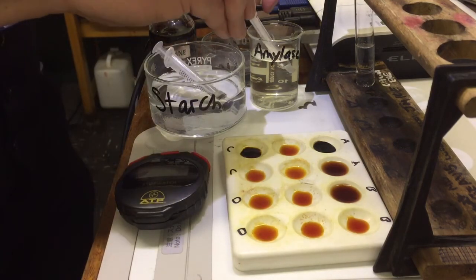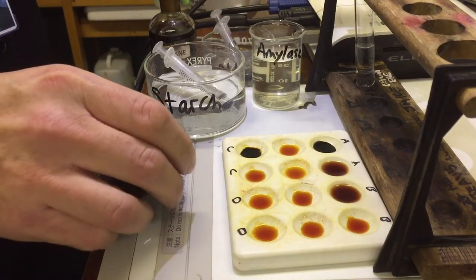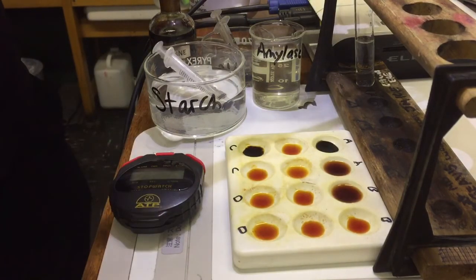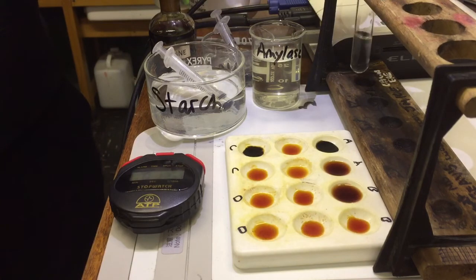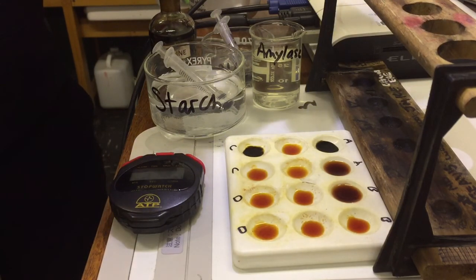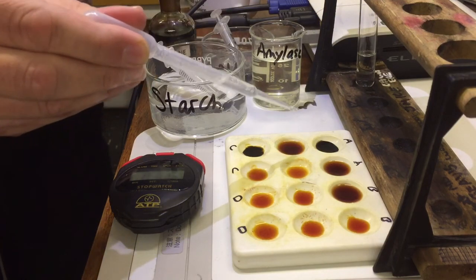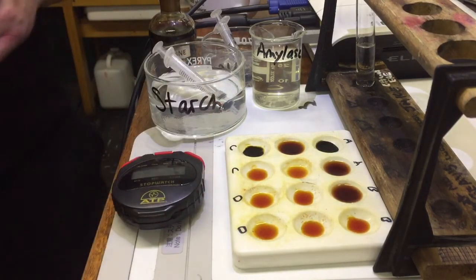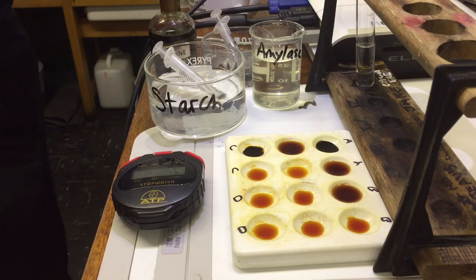I've got my amylase and I'm going to add half the amount this time. Reset the stopwatch — three, two, one, go. I'll mix it and after 30 seconds try it again. What I'm doing here is trialling — changing the method to make sure it works correctly. Because amylase is slightly different each time you do it, you have to trial this to see how well it works. Again, that's really, really fast. So we're going to recommend we dilute it down to one tenth. We'll let you try that out.